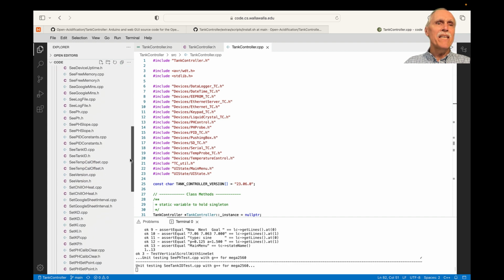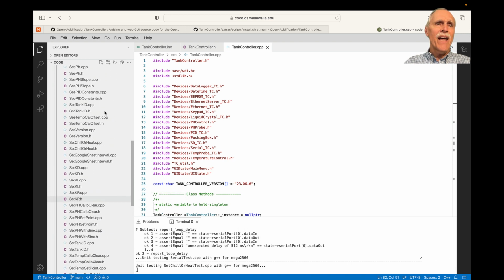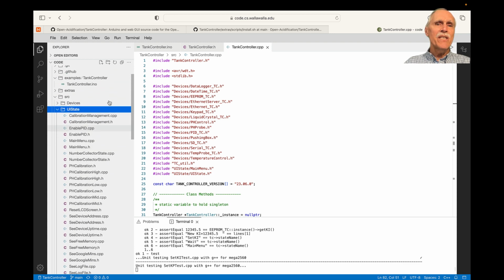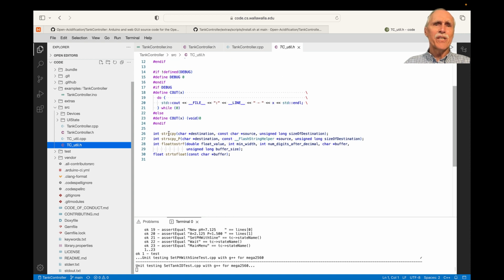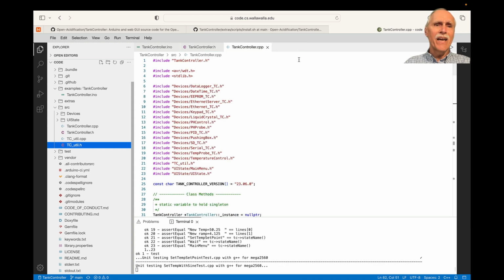We also have a directory for UI state, where we manage the main menu and then each of the things that can be done from the main menu, such as examine the time, set the calibration, set the pH, and see the tank ID, see the current pH, and so on. So these are the different UI states that the device can be in. We also have a few utility functions that handle such things as string copy, converting a float to a string, converting a string to a float, and some debugging interaction.